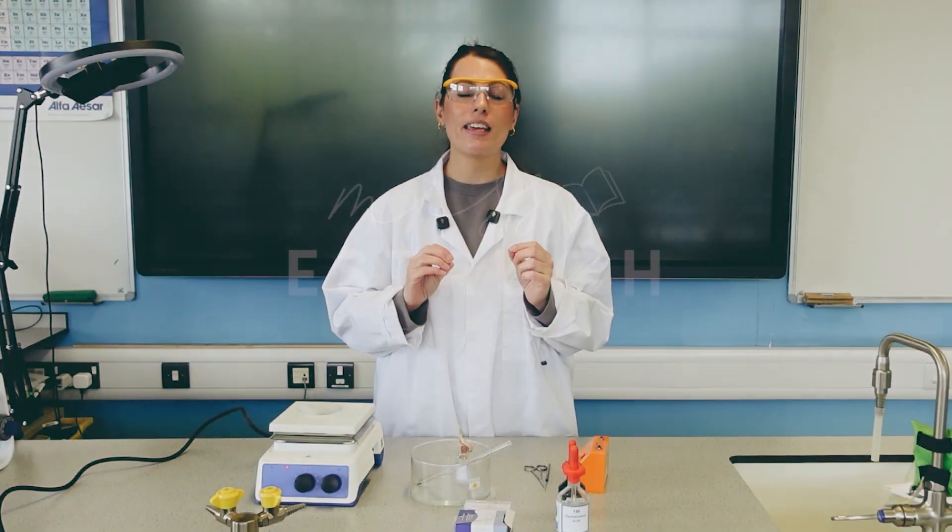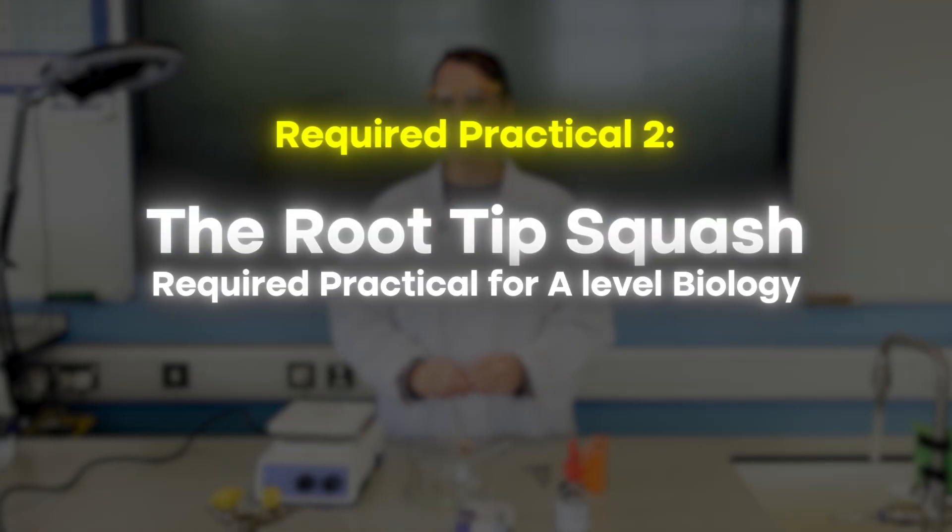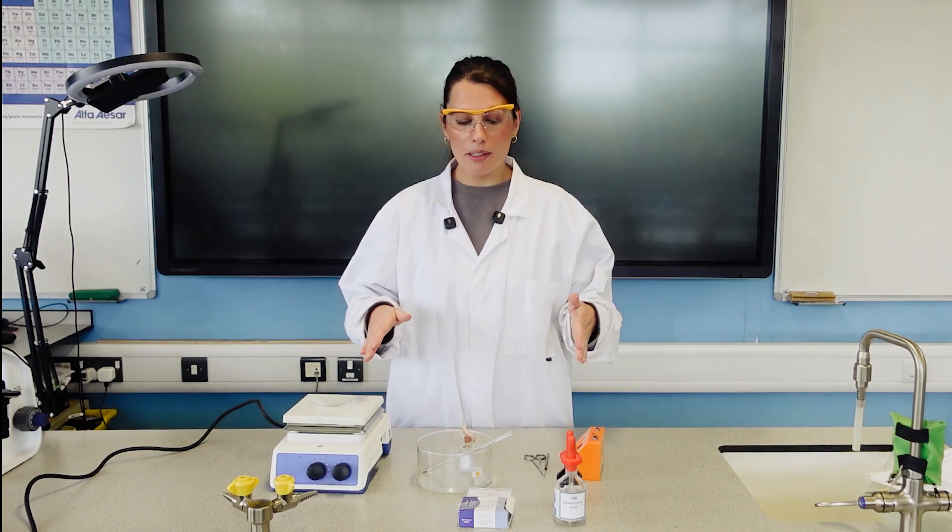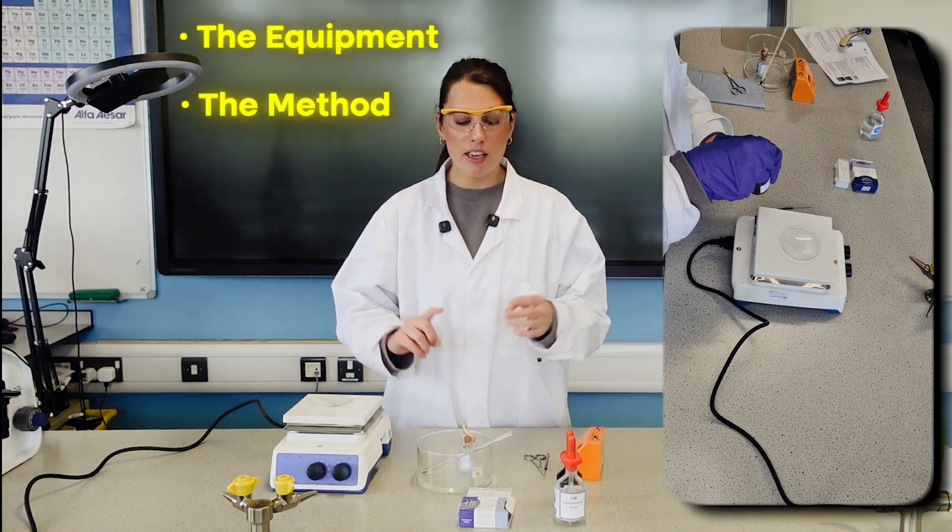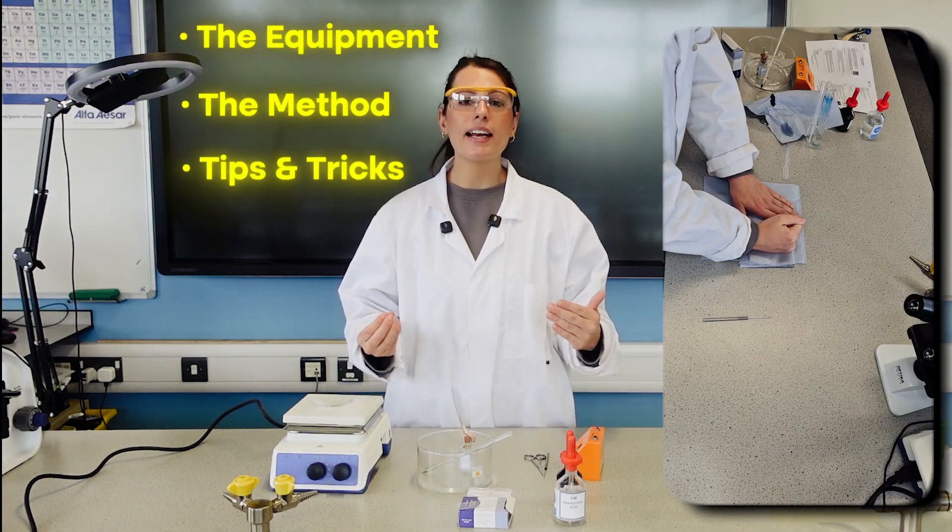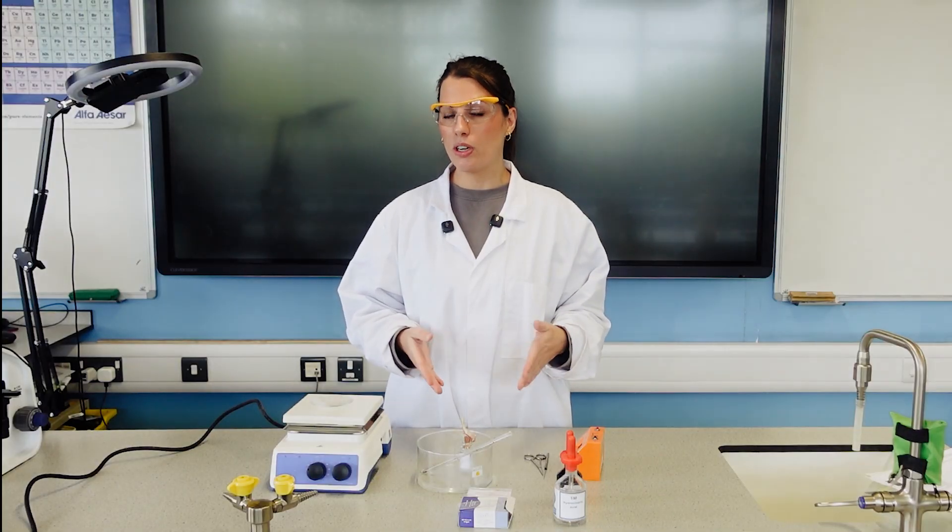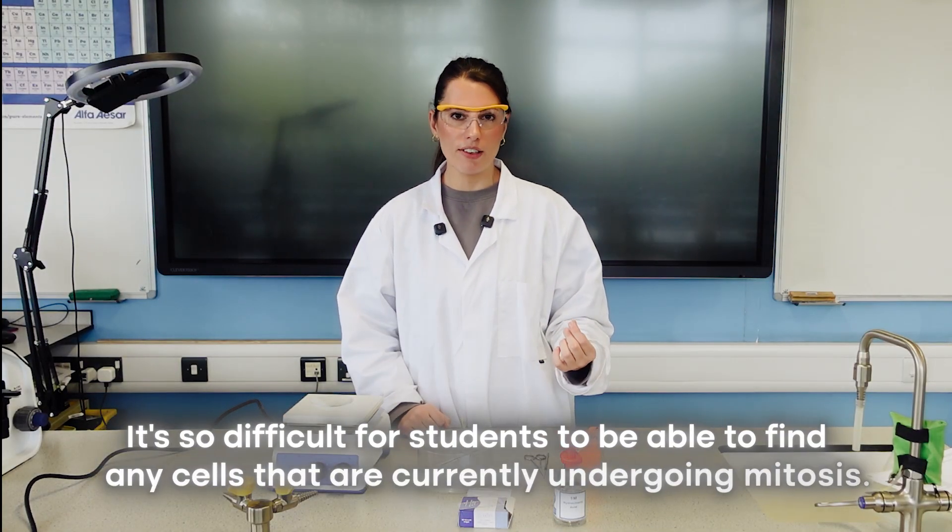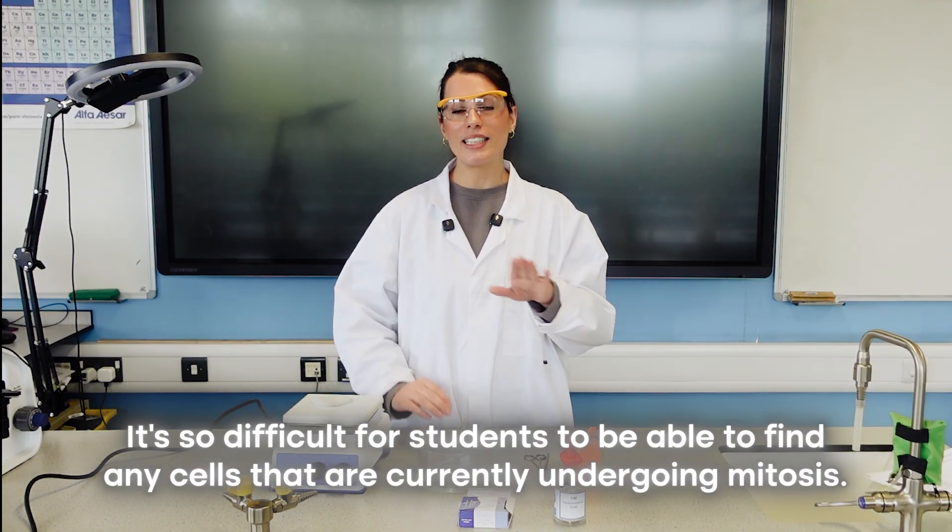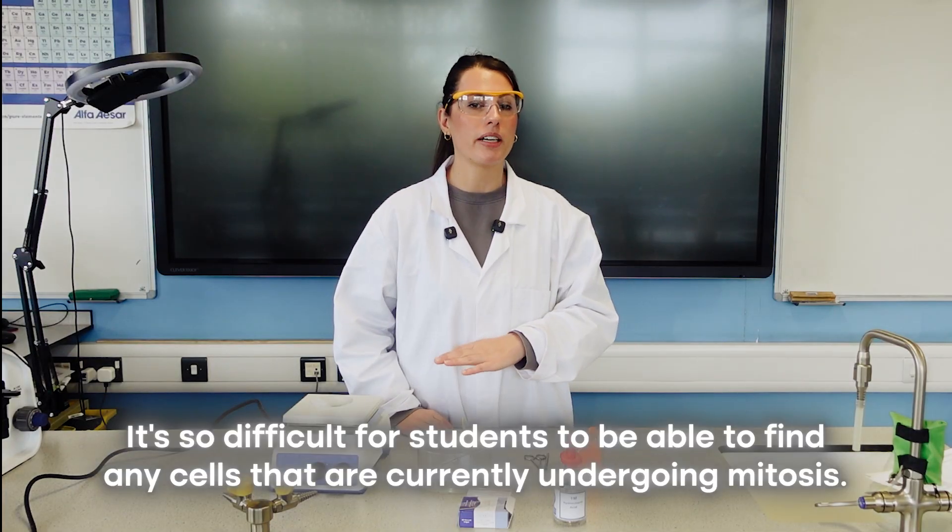In this video, I'm going to be going through the root tip squash required practical for A-level biology. We're going to be looking at the equipment, the method, and then tips and tricks to help make sure that it works. Because if you've ever done this before, you'll know it's notoriously difficult for students to find any cells currently undergoing mitosis.